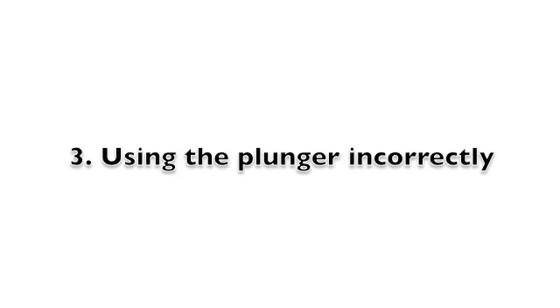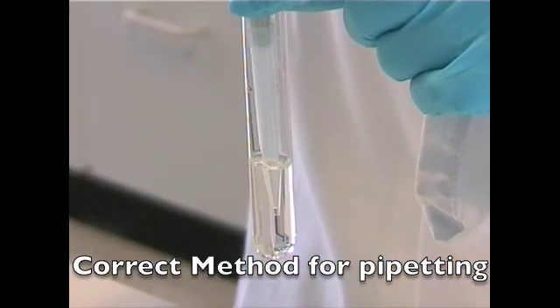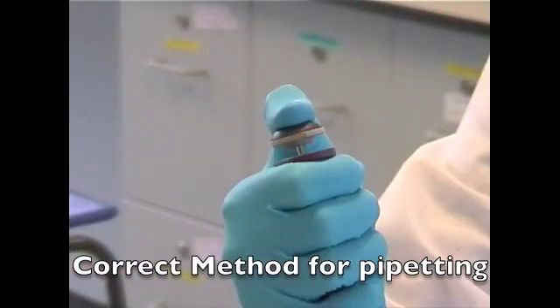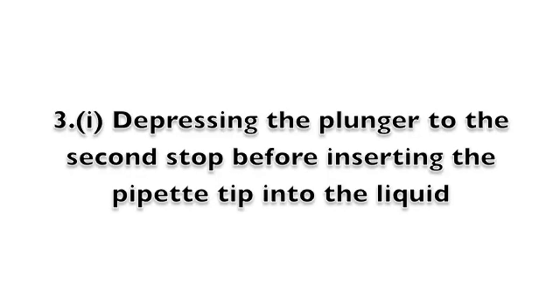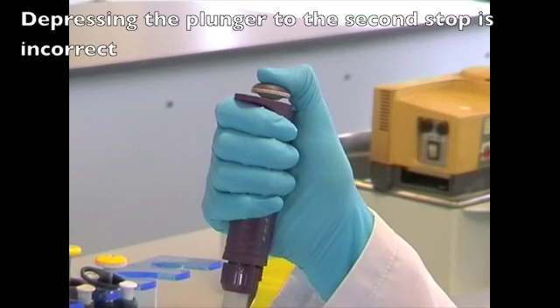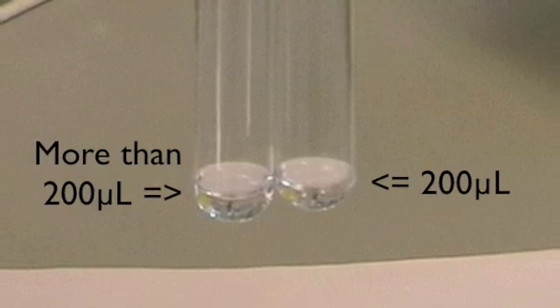Section 3. Using the plunger incorrectly. The correct method for pipetting is to depress the plunger to the first stop or point of resistance, immerse the tip in the liquid, and slowly release the plunger to its starting point. Depressing the plunger to the second stop before inserting the pipette tip into the liquid is incorrect and will result in an excess amount of liquid, as shown here.